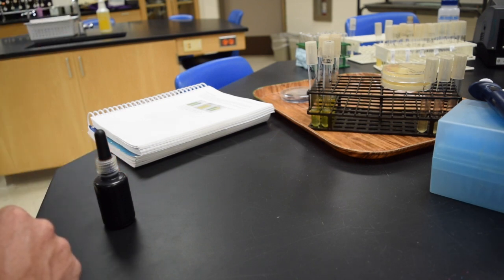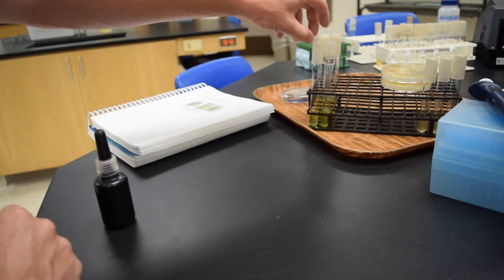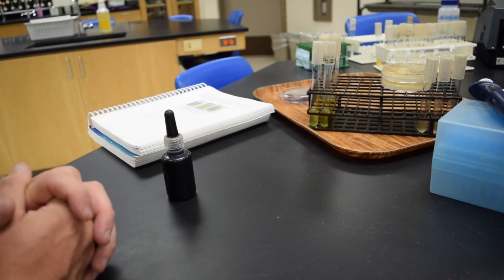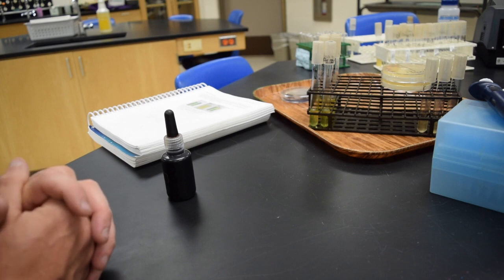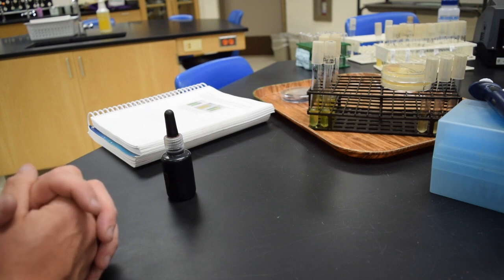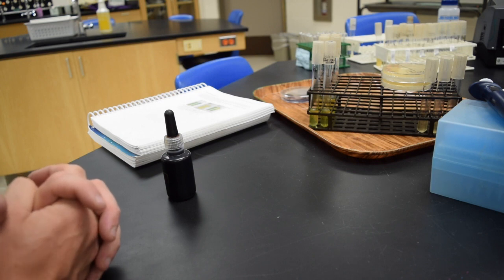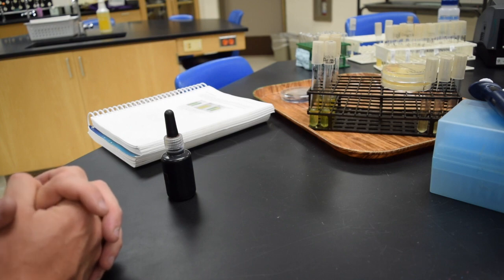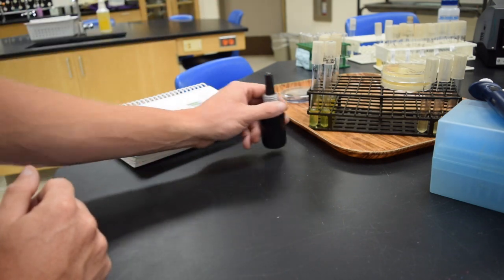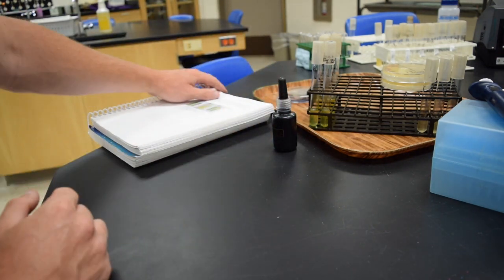So this media allows us to tell if the bacteria is fermenting glucose or oxidizing glucose. Fermentation can occur with or without oxygen. The bacteria are not using it. Oxidation of glucose occurs with oxygen, so the bacteria is using oxygen as a terminal electron acceptor in cell respiration. And then one of these organisms isn't using glucose at all, so you'll have to read that intro to lab 8 to determine which one is which.